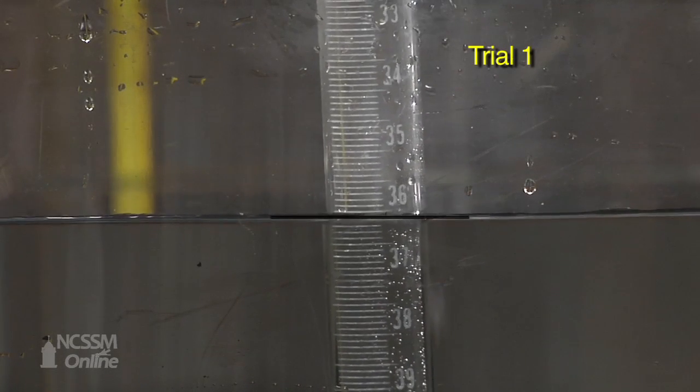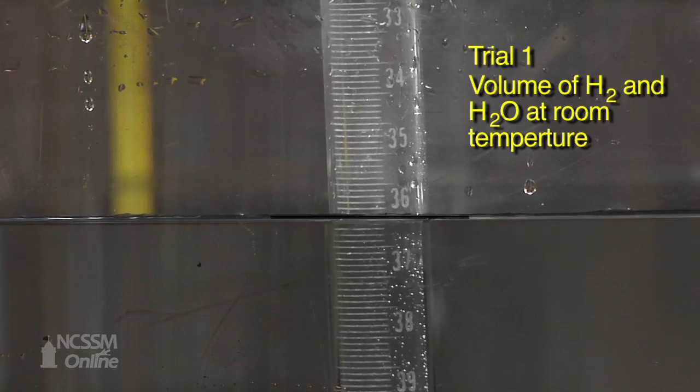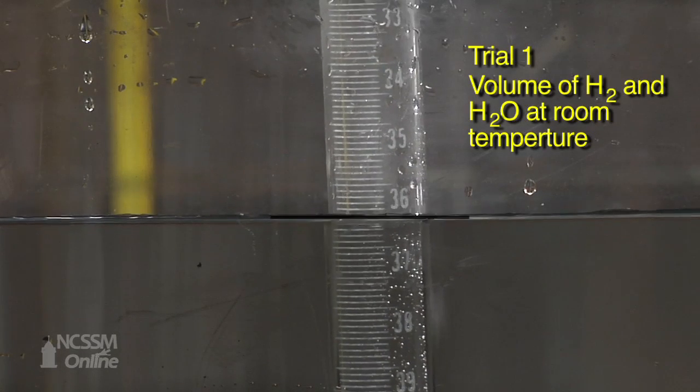And you'll need to take this measurement as the volume of the hydrogen and water vapor gas inside the tube.